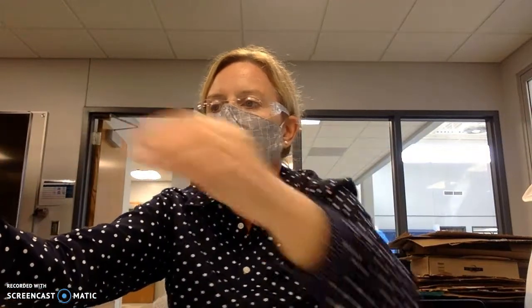And then I'm going to move this over here and place this over my hot water, like that. And then again, if I had ice, again, we're using our imagination, I would do the same thing. I would take a slide and I would place that in the petri dish on the ice cubes.